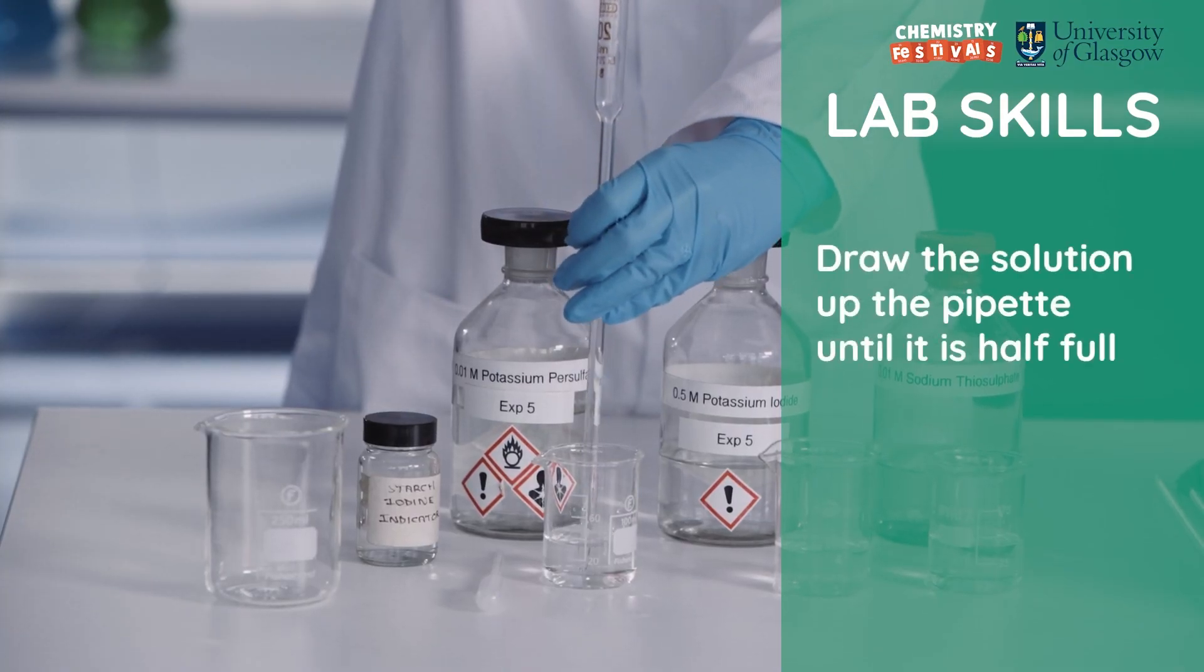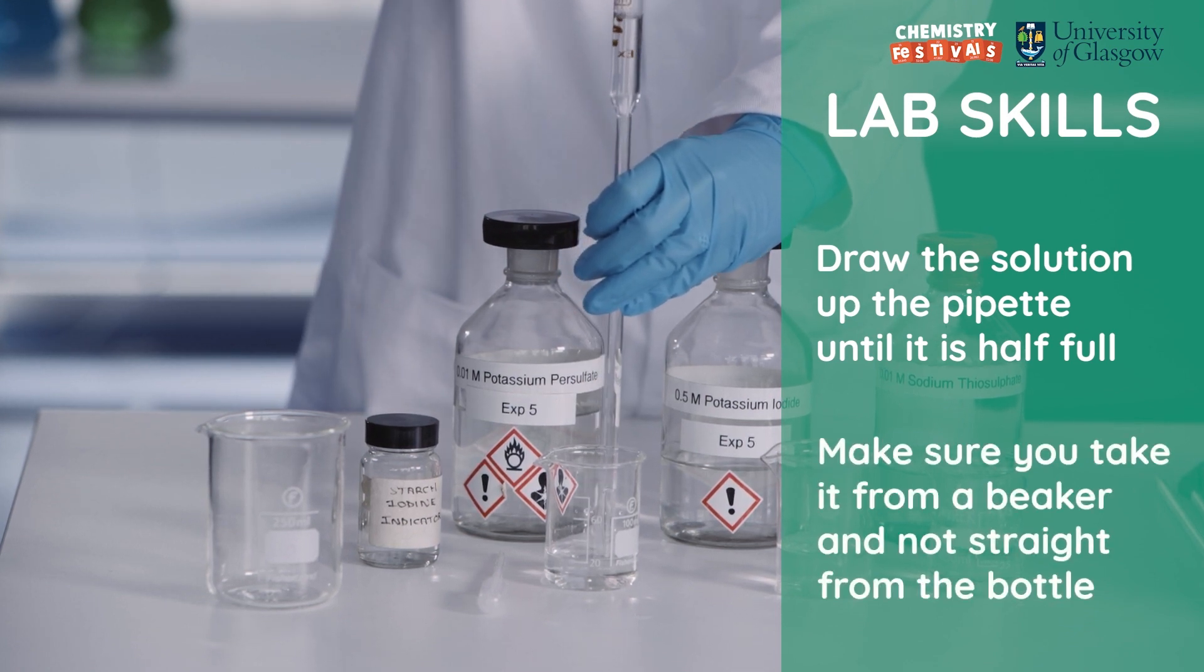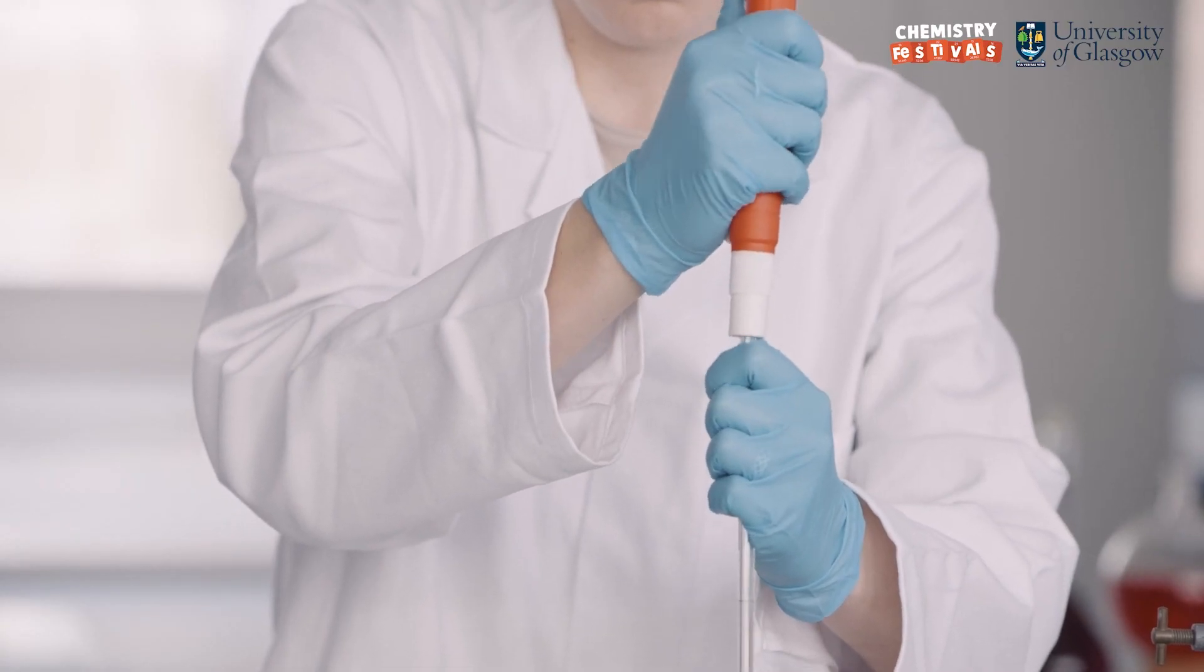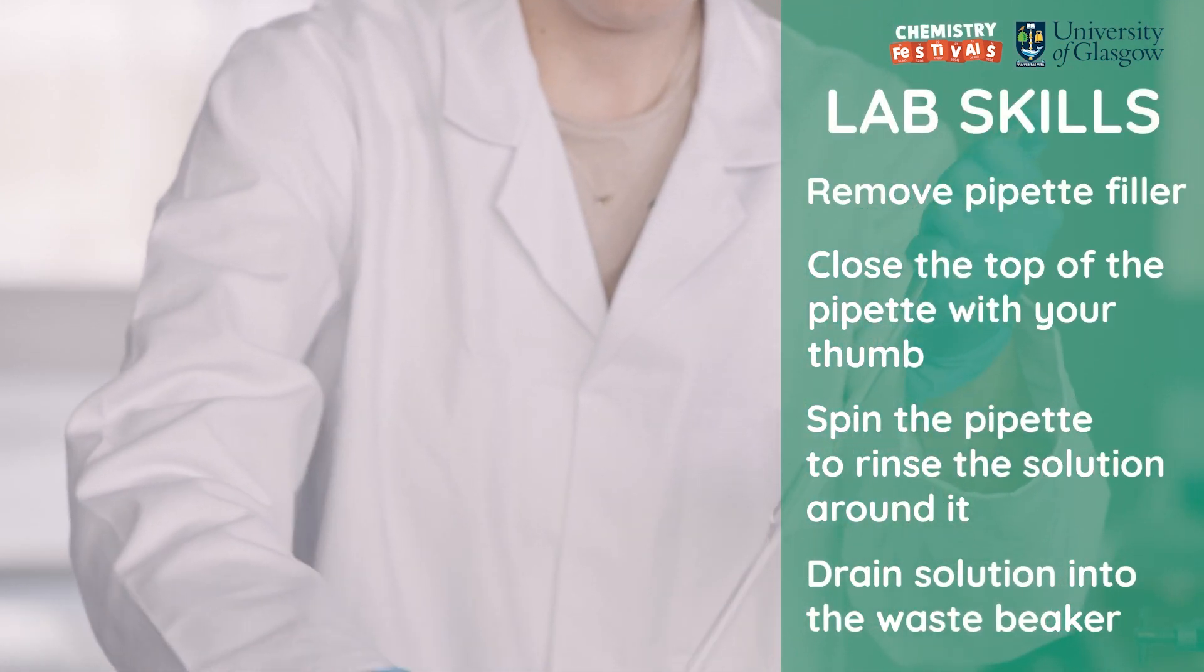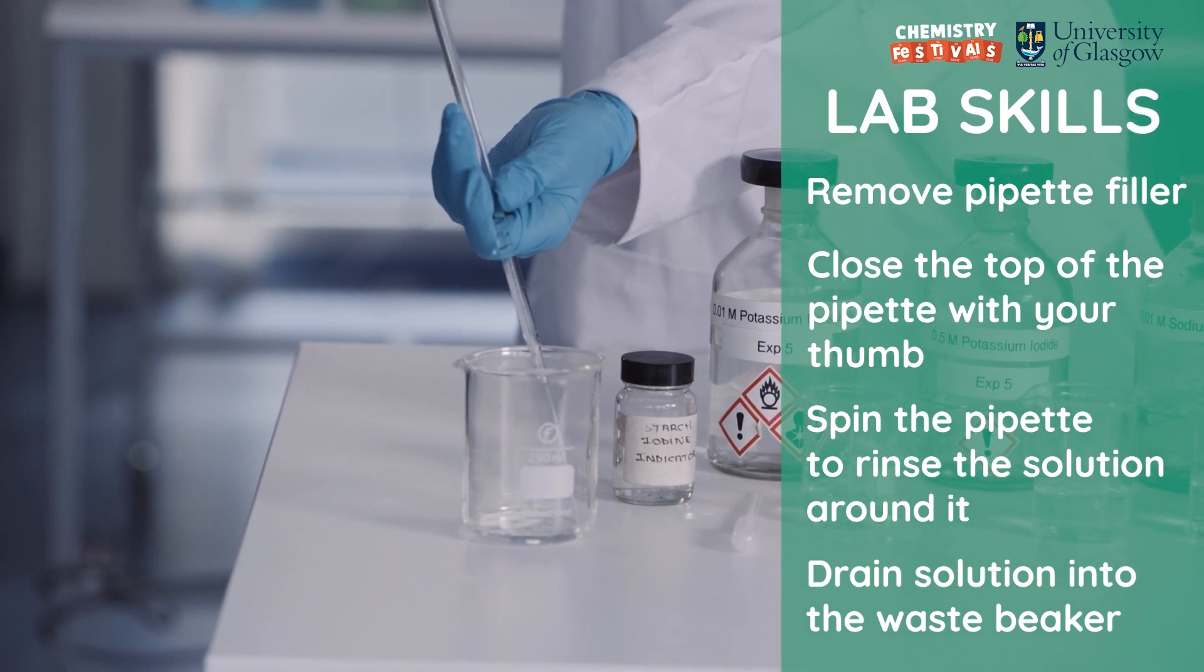Draw up the solution so that the pipette is half filled. I'll take off the pipette filler and close the top with my thumb. I'll now rinse the solution around the pipette, spinning it, and then drain it into the waste beaker.